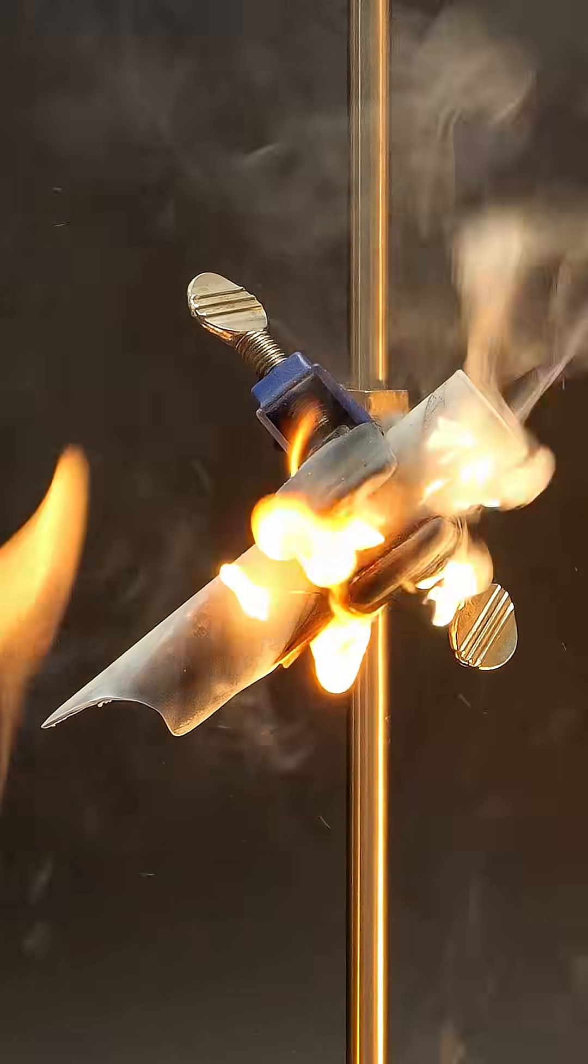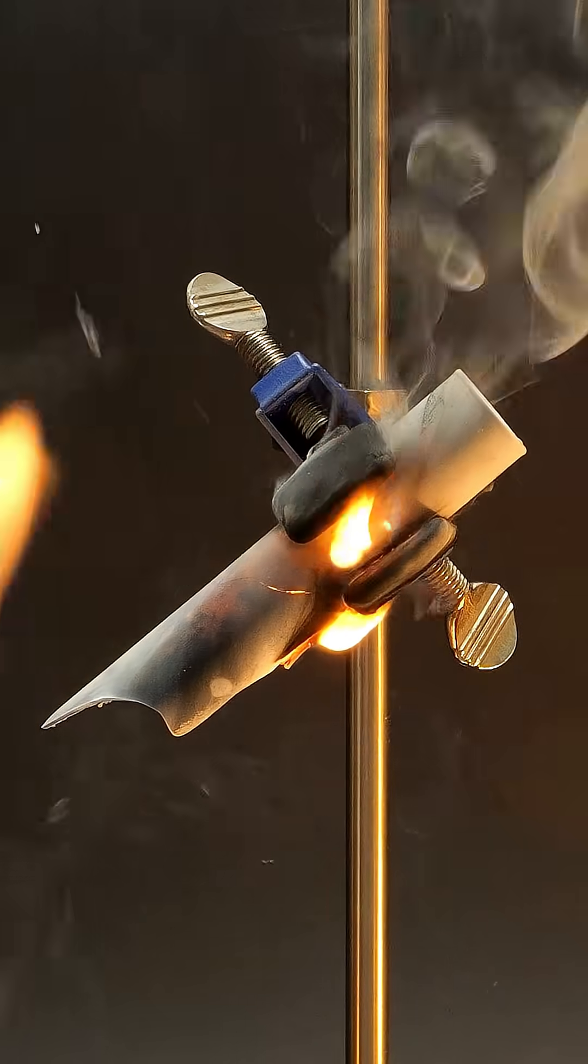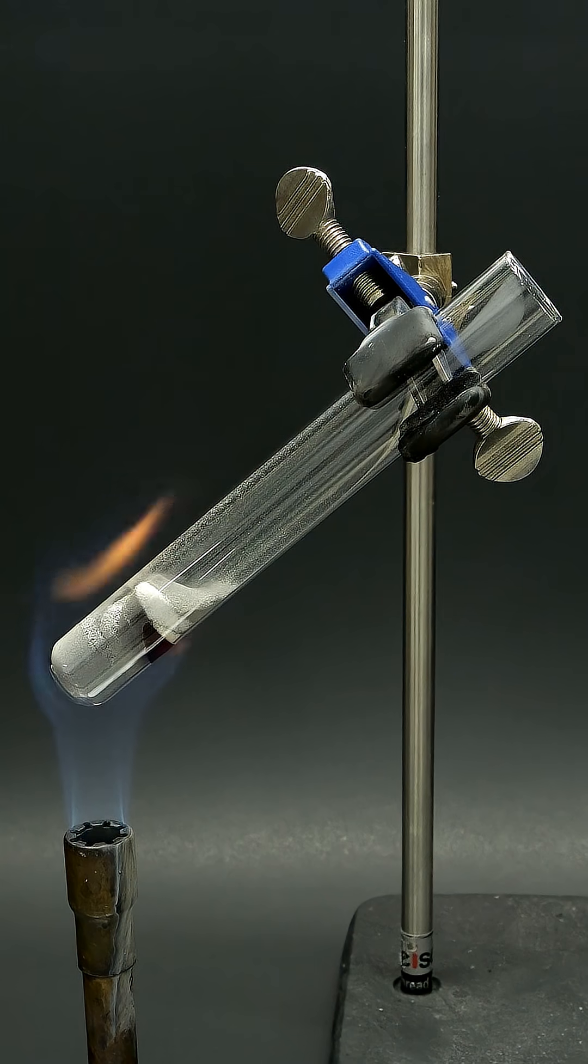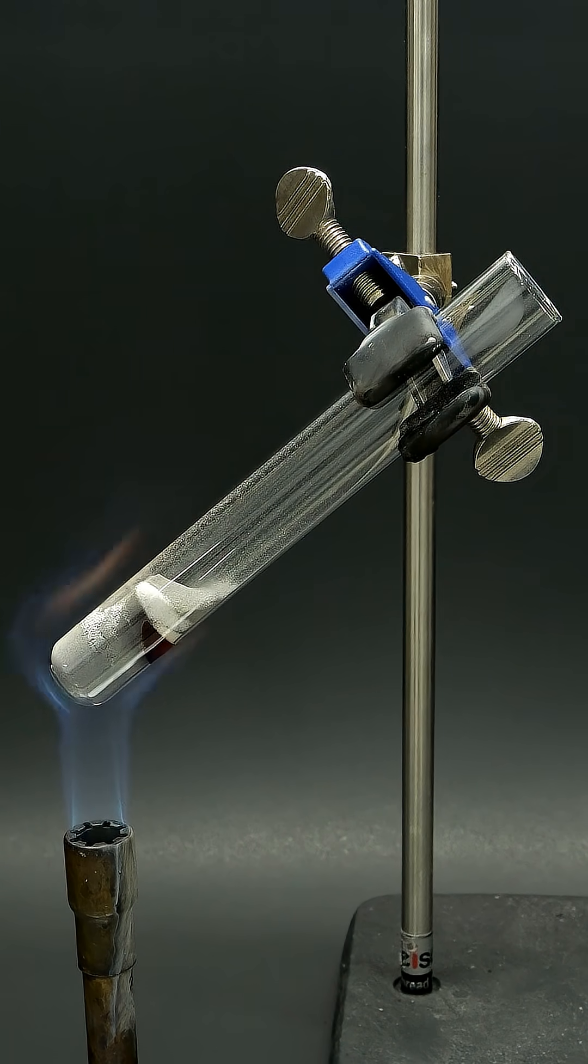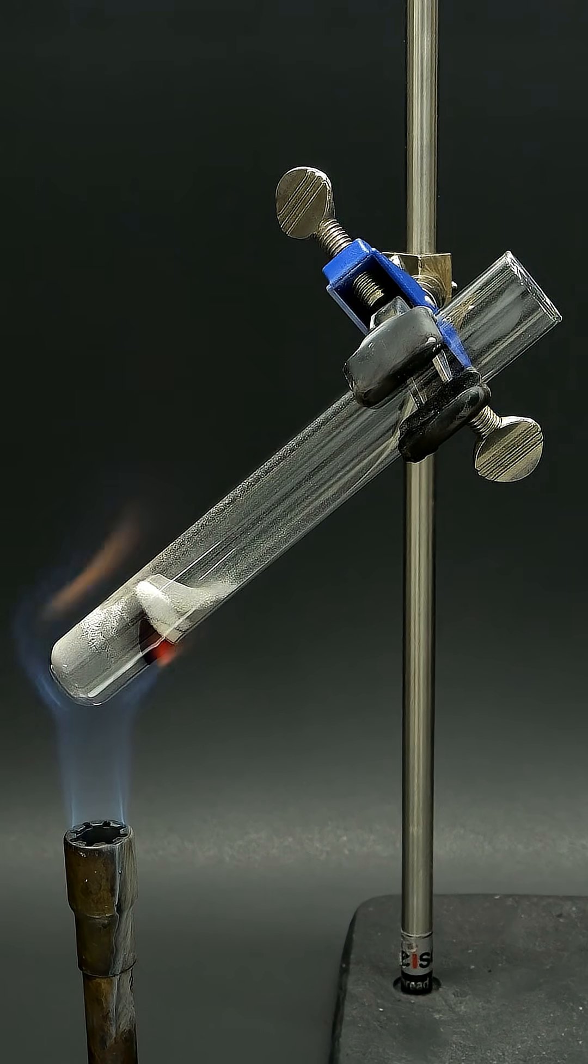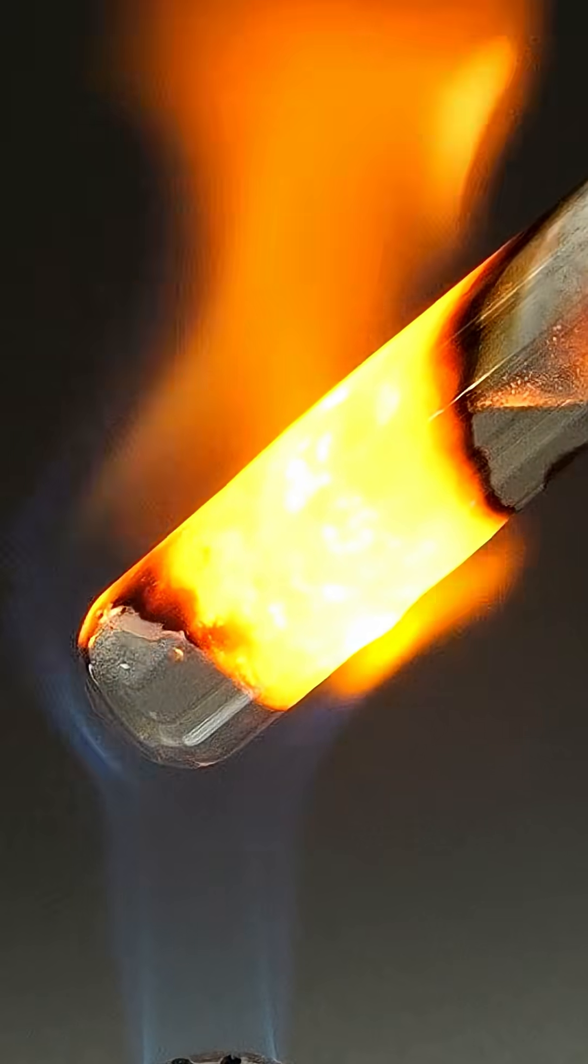I think this is just because I used a bit too much powder, so I quickly set it up again using much less. I was a bit worried that this would also explode, except it actually worked.